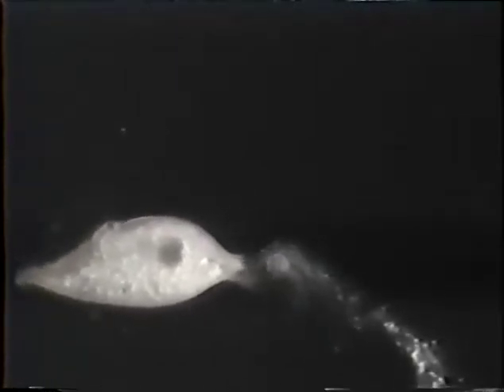This is a blepharisma organism undergoing disintegration at an applied MOR, or mortal oscillatory rate, of 3,050 cycles. At a later date, it was found that a better MOR for blepharisma is 924 cycles. The difference is that in about 40 seconds at 924 cycles, many blepharisma will start to disintegrate. At 3,050 cycles, a process you're seeing here took approximately 20 minutes to get to this point. This is all live time, however.